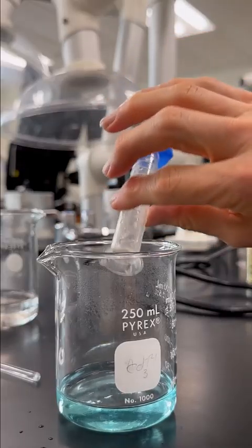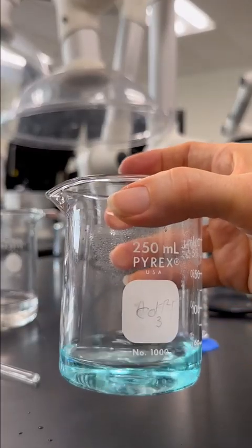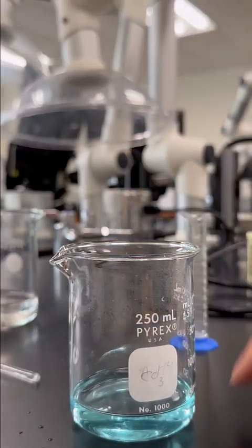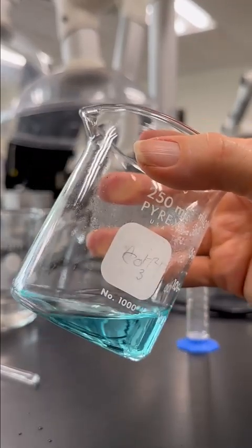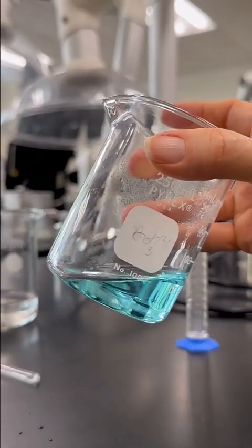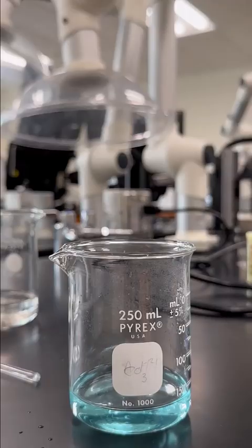This is just going to dissolve right now into the solution. So I'm making the hydrogen protons and the chloride ions in the solution. This has not really changed the copper at this point. The copper is floating around in there as copper 2 ions. Right? My chloride ions are floating around and my sulfate ions are floating around. But the chloride likes to react with the aluminum foil more than the sulfate does. All right, so let's go ahead and weigh out our aluminum foil.